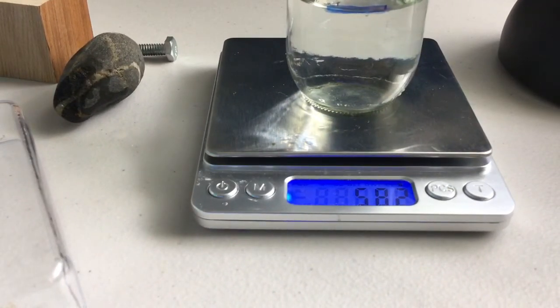So again, density is mass divided by volume. So we're trying to figure out how many atoms are packed into a certain amount of space, which is the volume. And in just a little bit, I'm going to talk to you about how to calculate the density. So now that we've measured all of these, we're going to take these numbers and calculate the density.